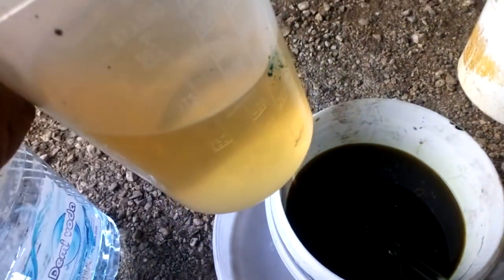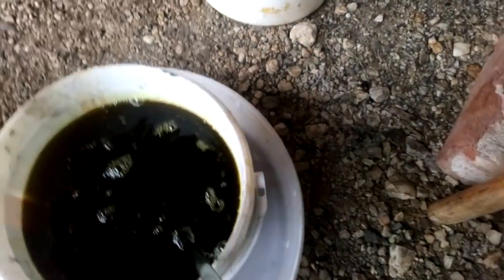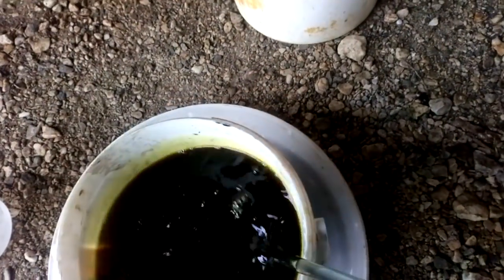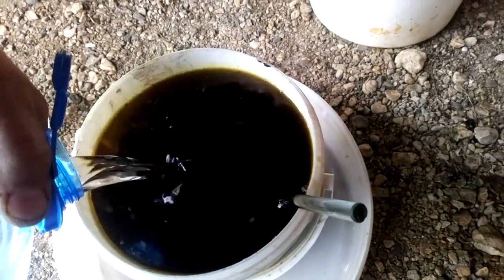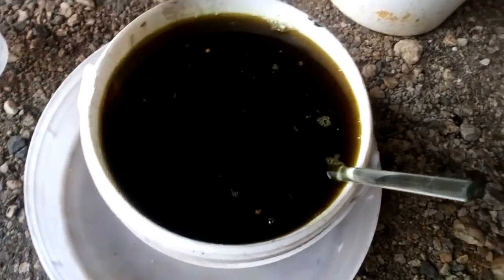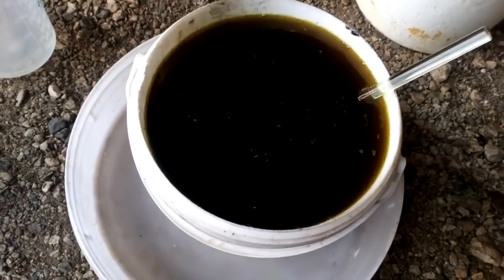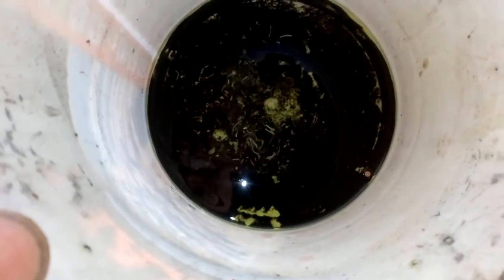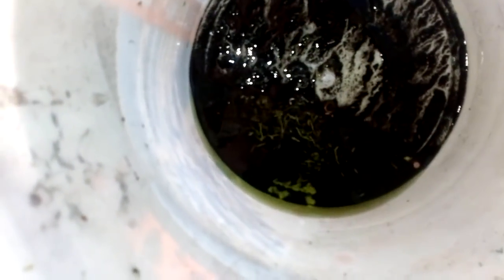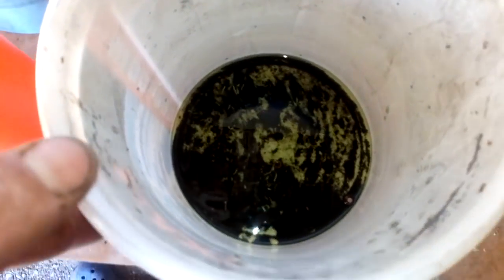Okay, rinsing that dish — we got dissolved SMB. Now we drop some gold and we add distilled water to the top. Now we're gonna leave that overnight. Okay guys, after decanting, this is our gold from those transistors. It's not that heavy — not bad. So we're gonna filter this and go to melt.